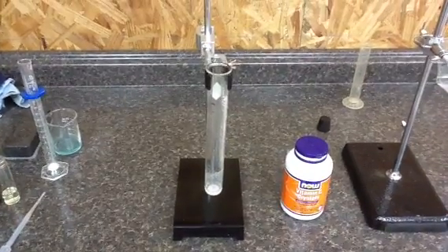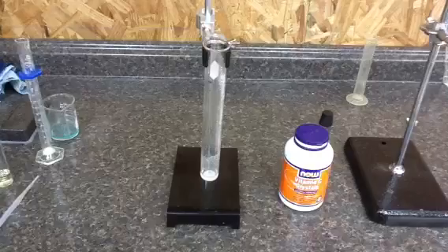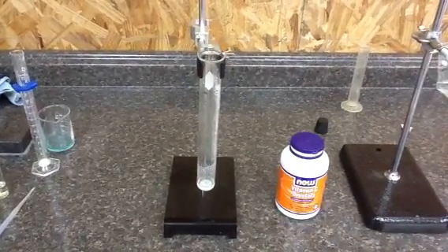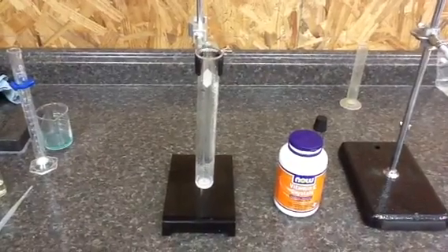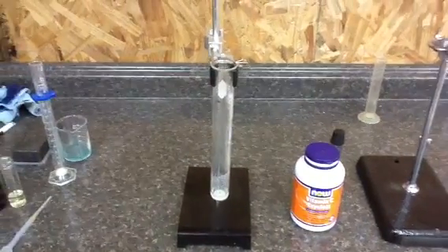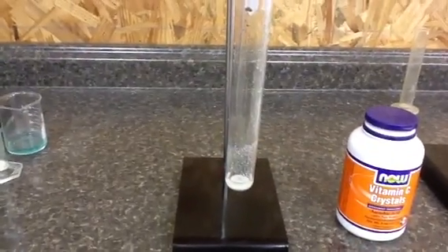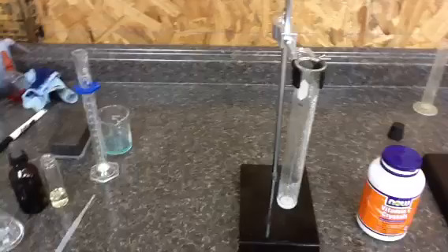What we have here is a solution of approximately 1.2 milligrams of vitamin C crystals, and I've added to it 1 cc of 50% hydrogen peroxide. It has been sitting here in the test tube for about 5 minutes, and you see not much is going on.